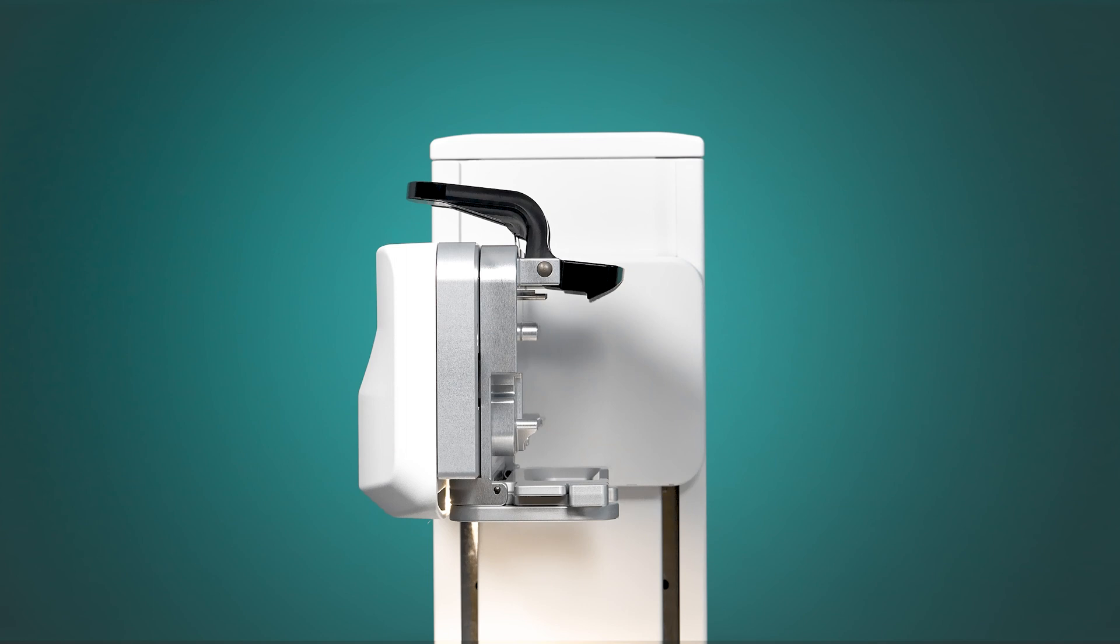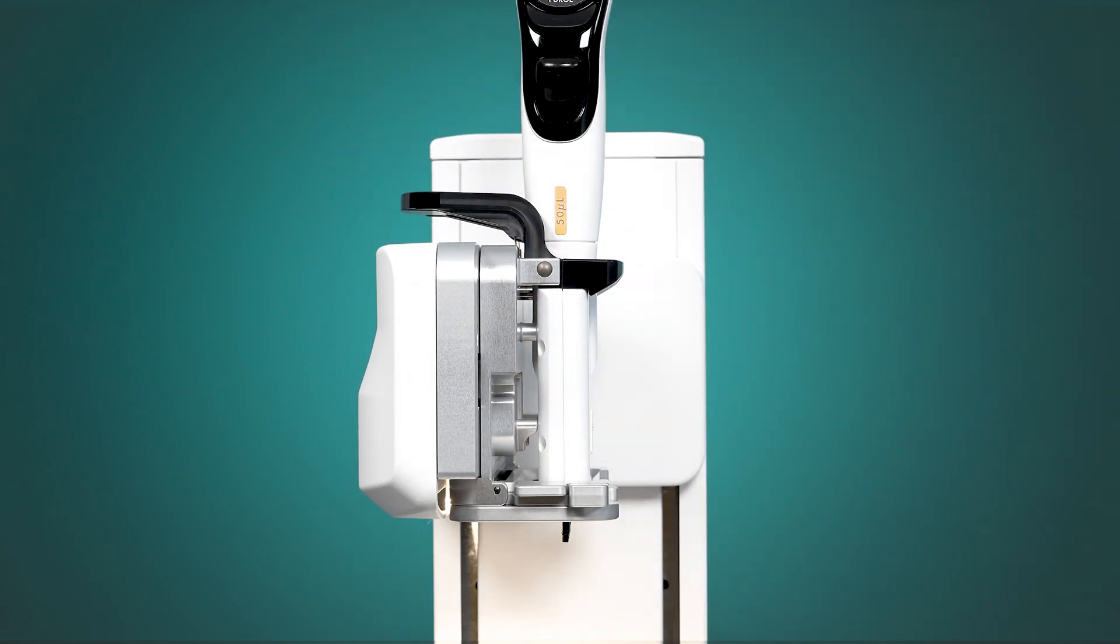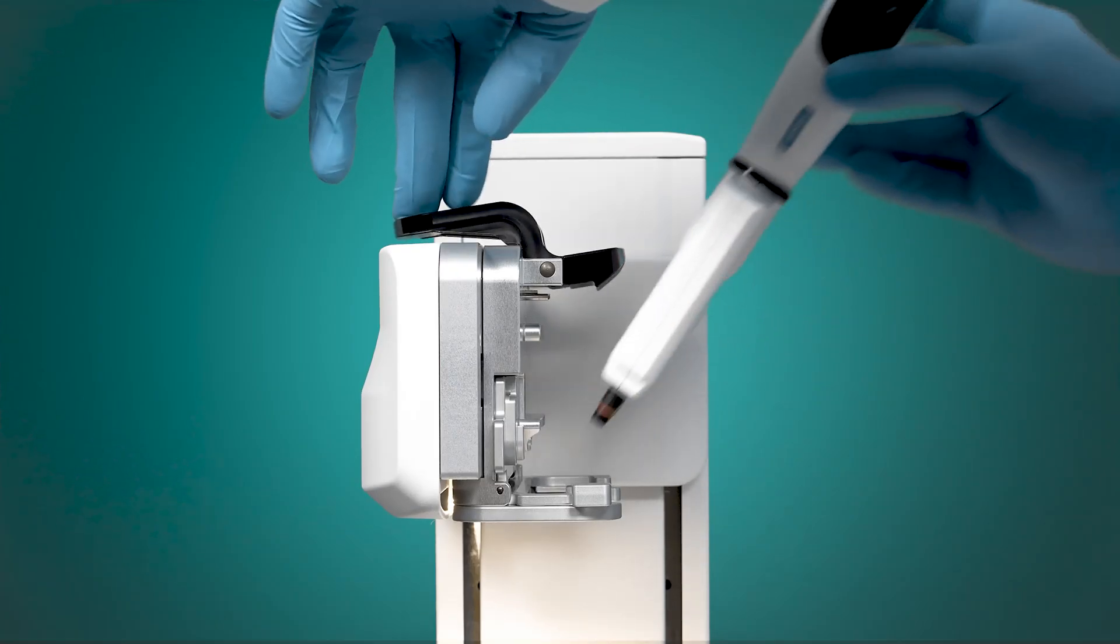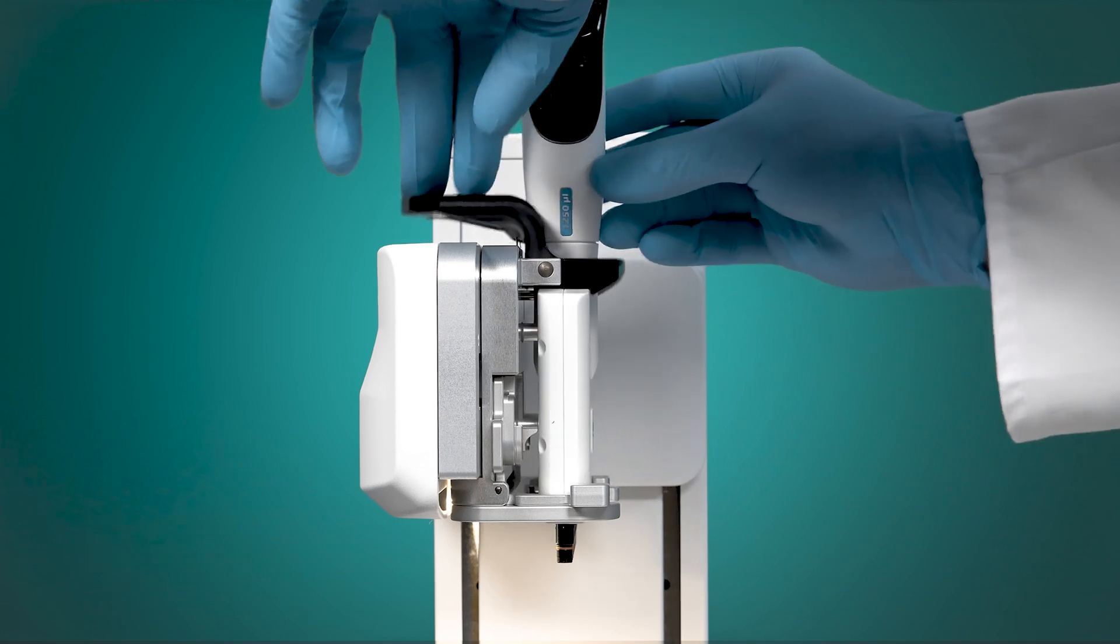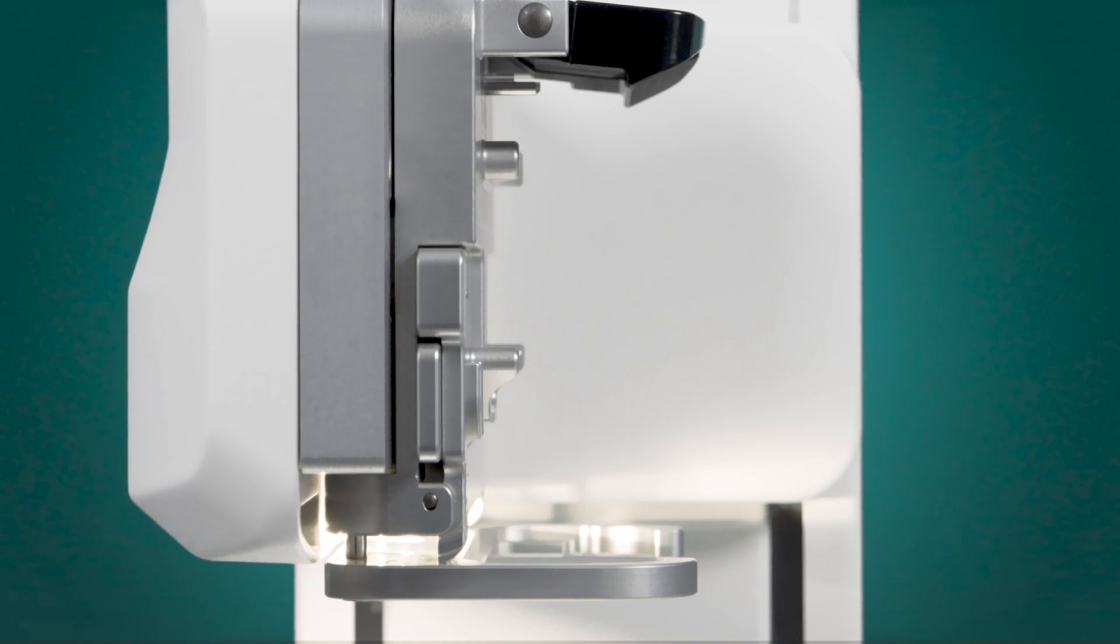The first adapter is for positioning any of our 8-channel or 16-channel Viaflo electronic pipettes. The second adapter allows to place a 12-channel Viaflo pipette. The last, third adapter is for our Voyager pipettes and D1 pipetting modules.